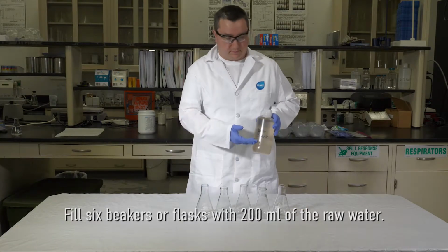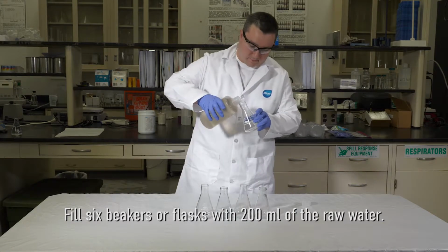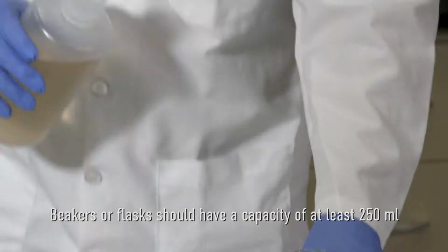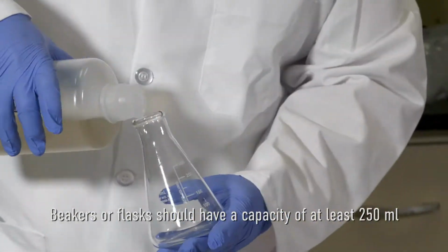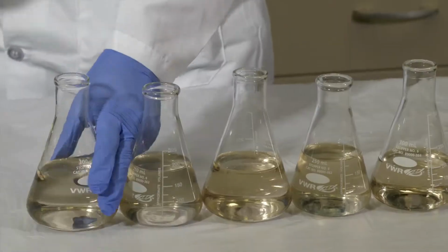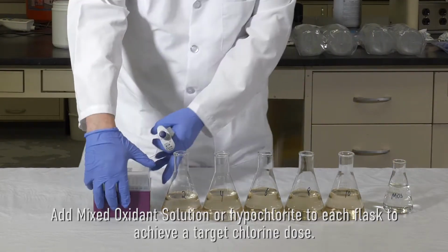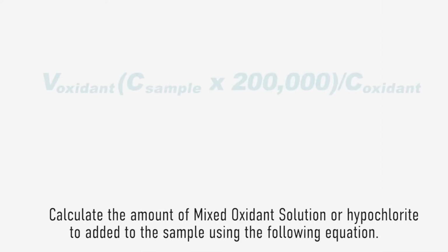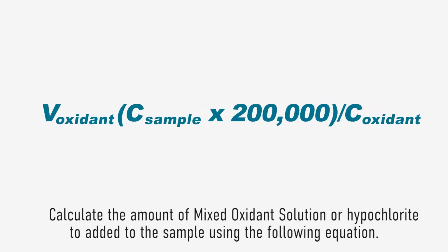Fill 6 beakers or flasks with 200 milliliters of raw water. Beakers or flasks should have a capacity of at least 250 milliliters. Add mixed oxidant solution or hypochlorite to each flask to achieve a target chlorine dose. Calculate the amount of mixed oxidant solution or hypochlorite to be added to the sample using this equation.